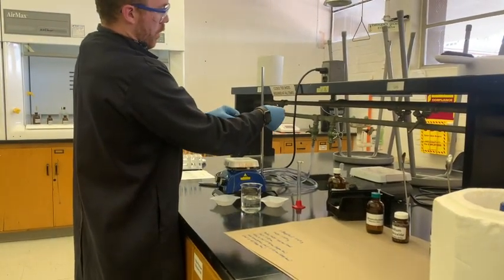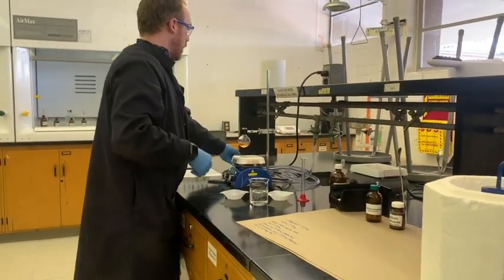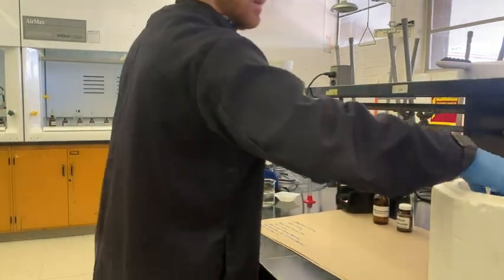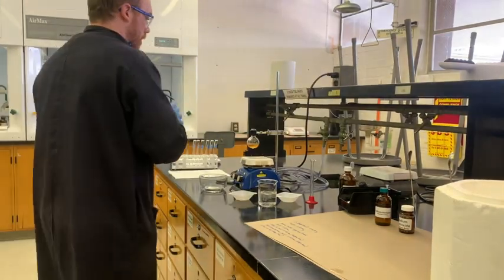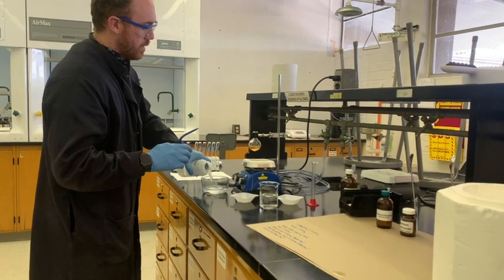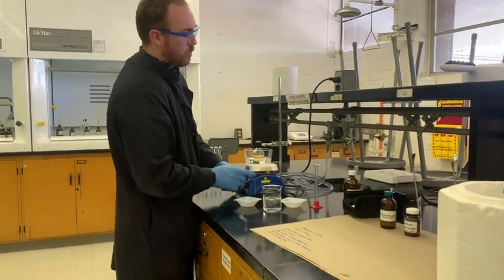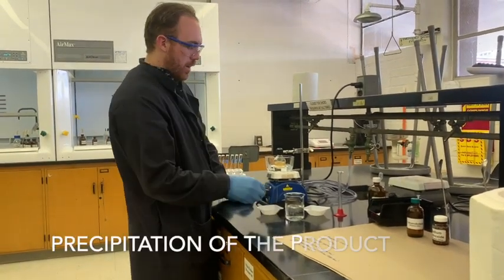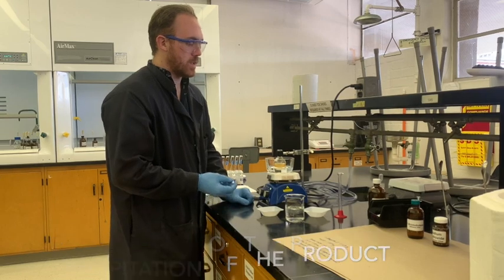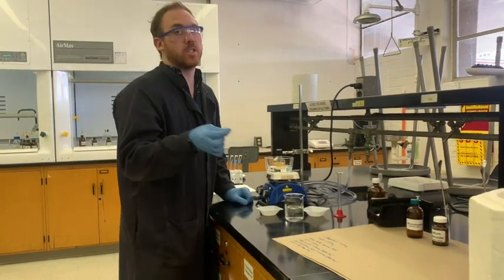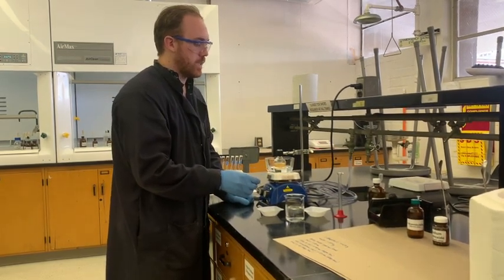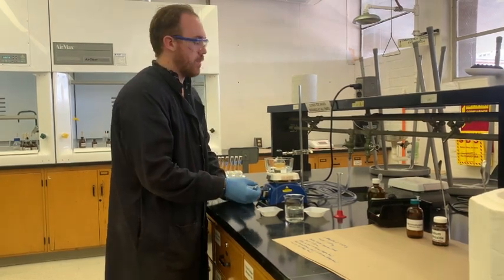So we're going to let it cool down. One way to let it cool down more quickly is to put a little bit of cool water around the flask just to get it down to 50 degrees Celsius.